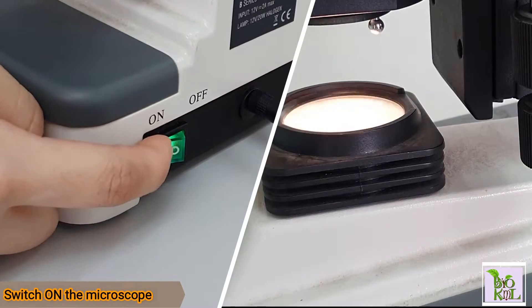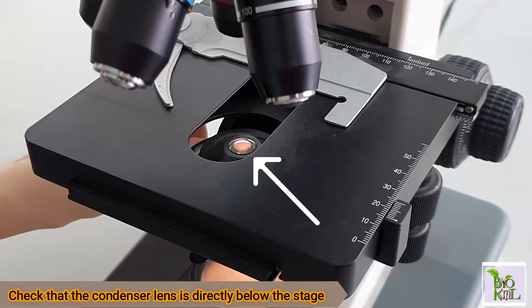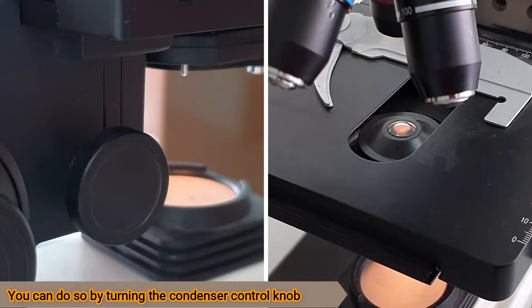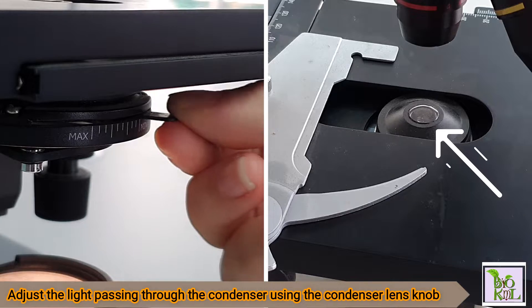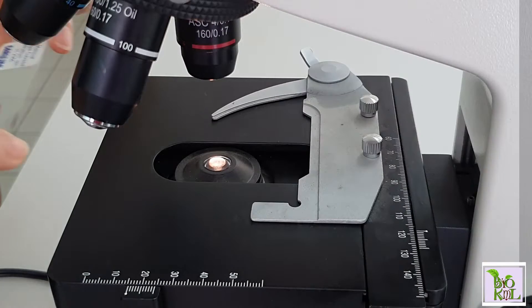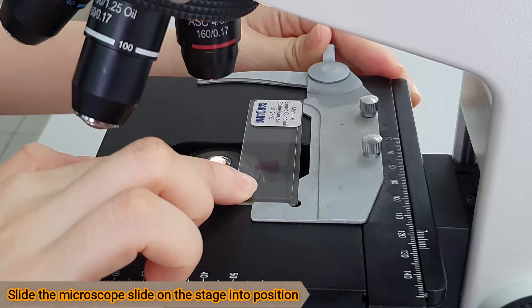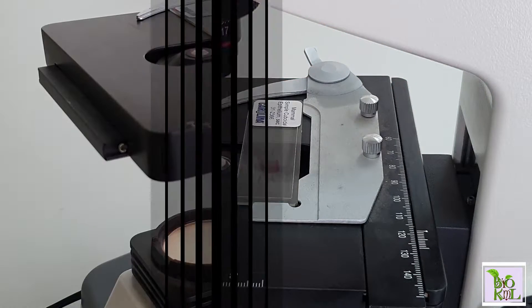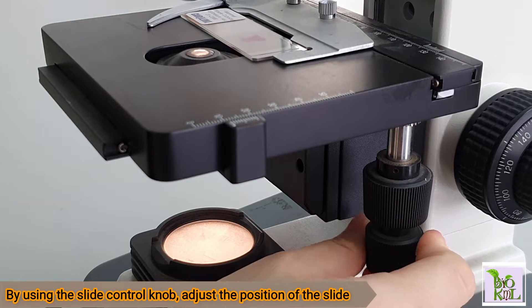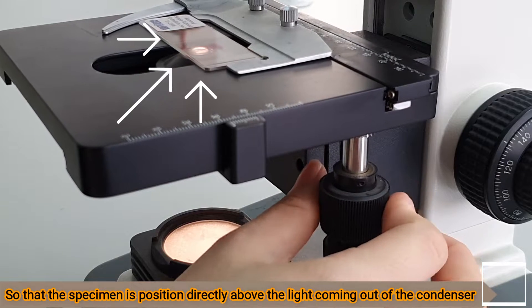Switch on the microscope. Check that the condenser lens is directly below the objective. You can do so by turning the condenser control knob. Adjust the light passing through the condenser using the condenser lens knob. Open the slide clip with one hand. Slide the microscope slide on the stage into position. Using the slide control knob, adjust the position of the slide so that the specimen is positioned directly above the light coming out of the condenser.